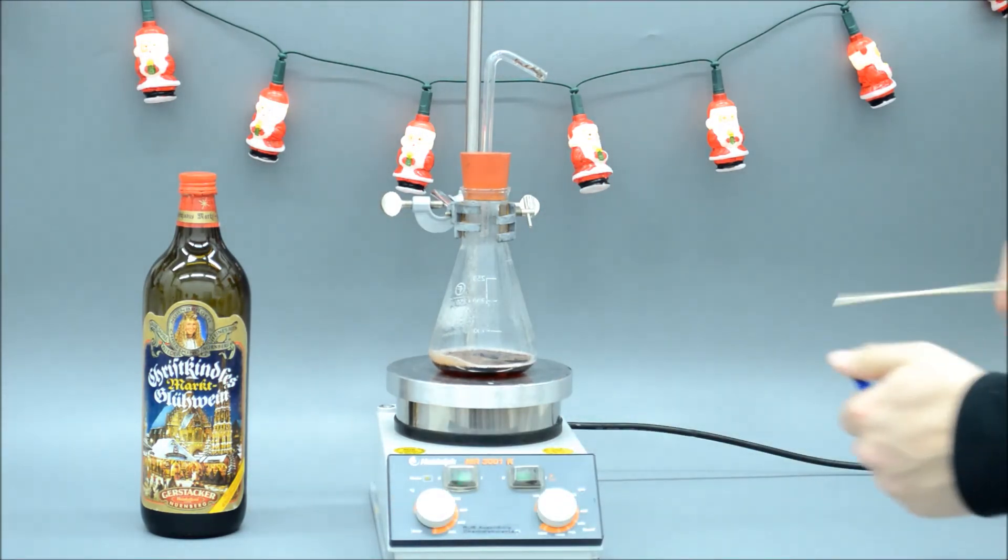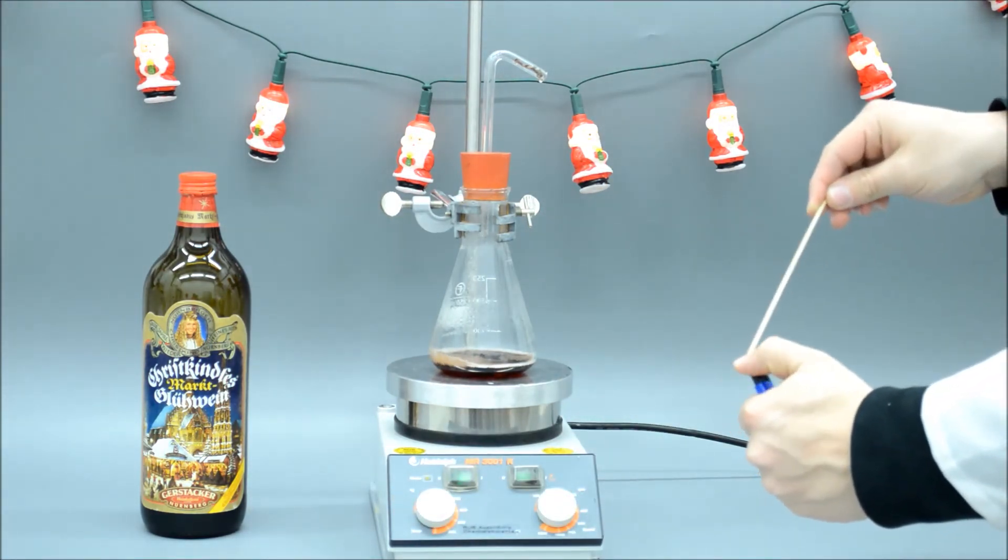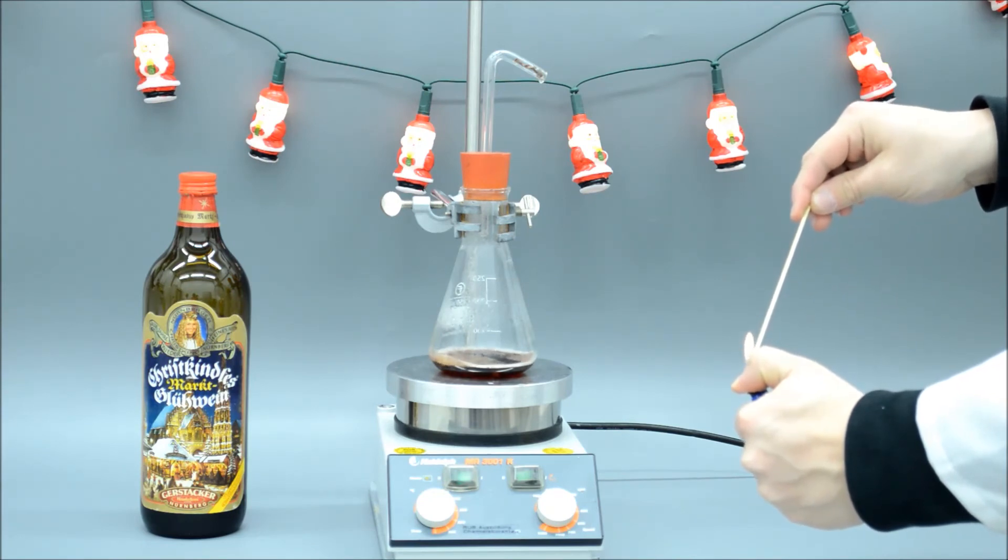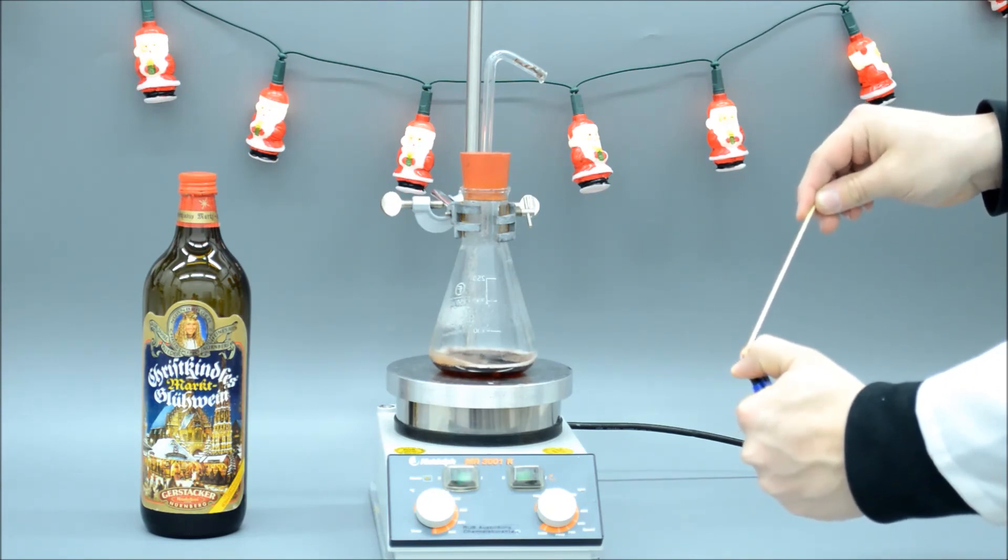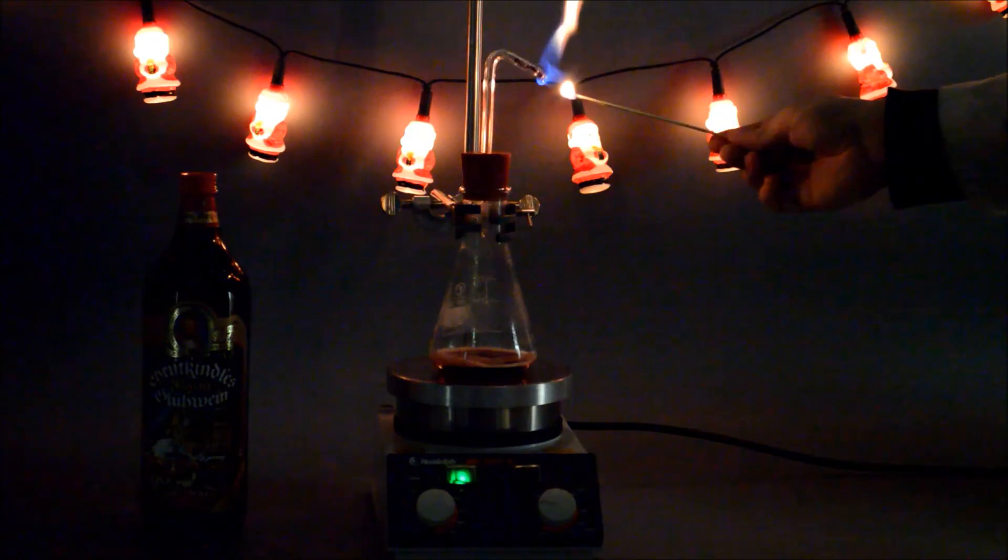Now it's time for our test. We light a wooden splint and hold it directly at the open end of the tube, where the vapour comes out. The vapour ignites and continues burning on its own.